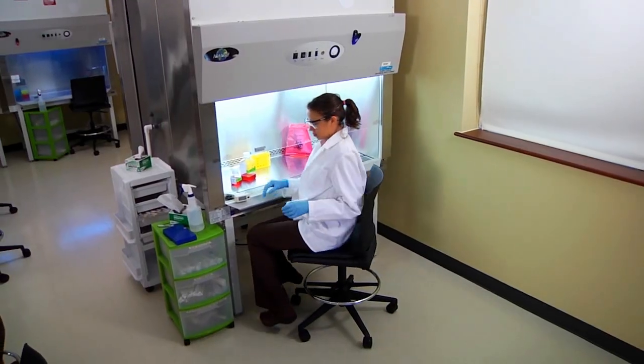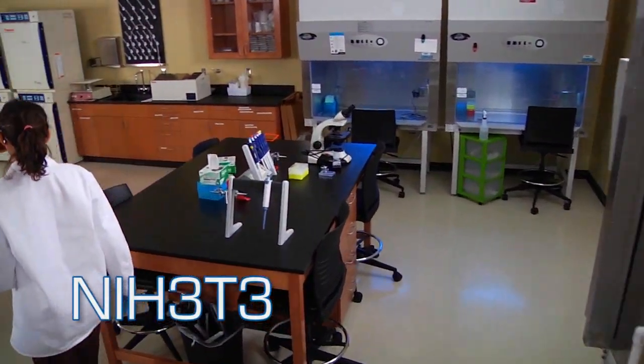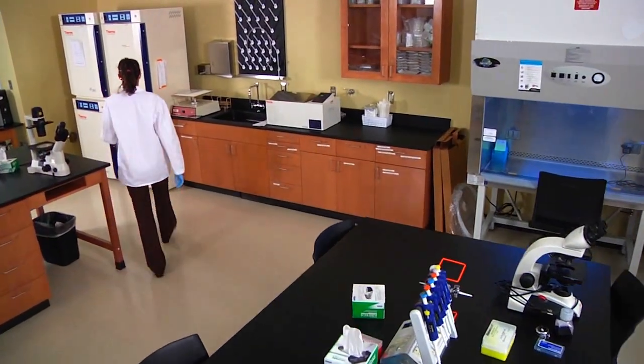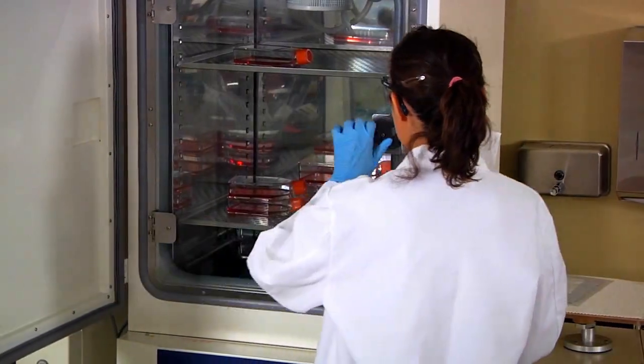In this experiment, we'll demonstrate the steps for propagating a culture by transferring NIH3T3 cells from a previous culture to a new culture vessel. To begin, remove the cultured cells from the incubator.